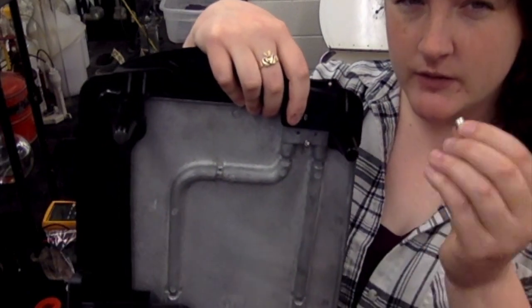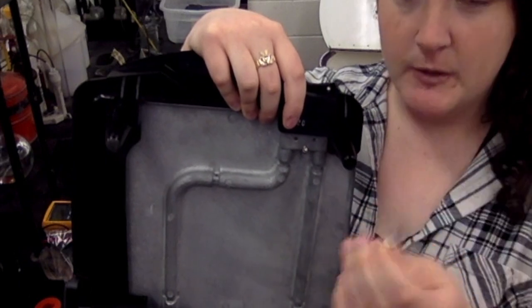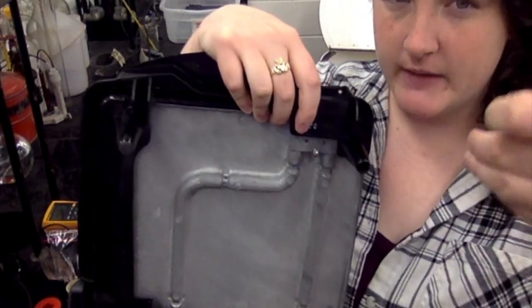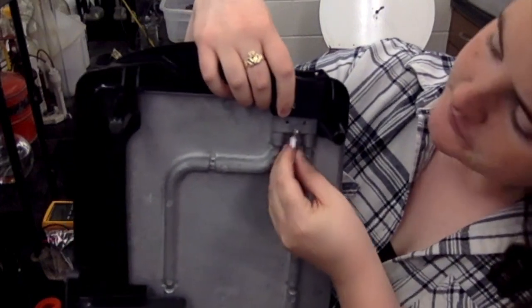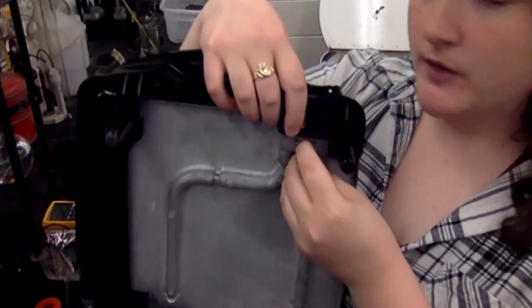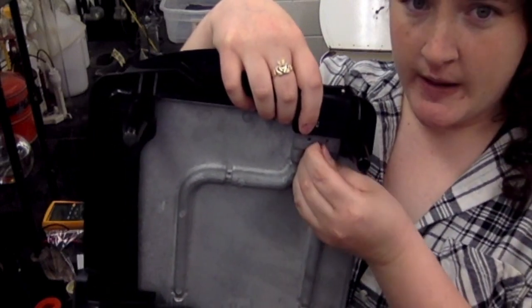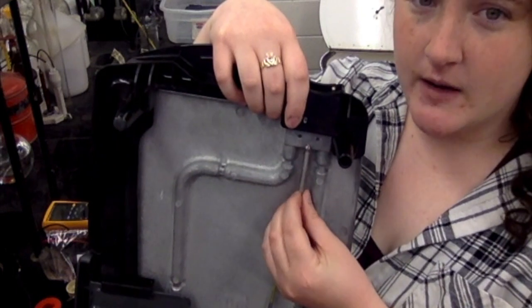It's important that you don't tighten that screw down too tight because you don't want too much pressure on the thermocouple. You just want it to kind of lightly pin it in place. So yeah, this is just going to go up inside that canal, and then you'll tighten down the screw, and then put the thermocouple in there, and then tighten that down once that's in there.